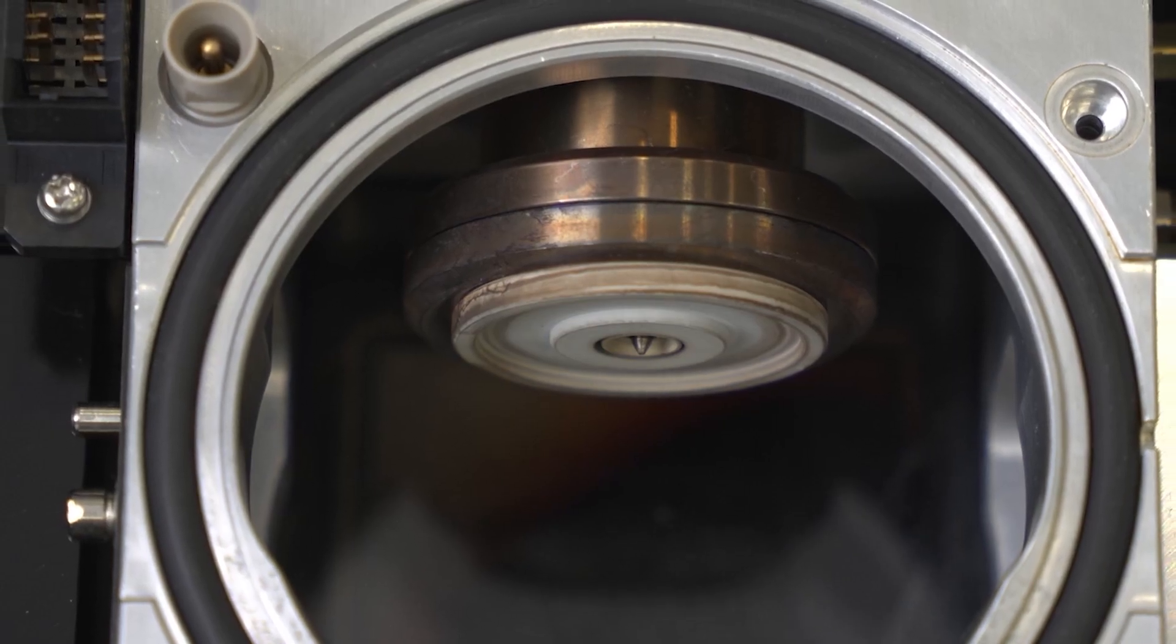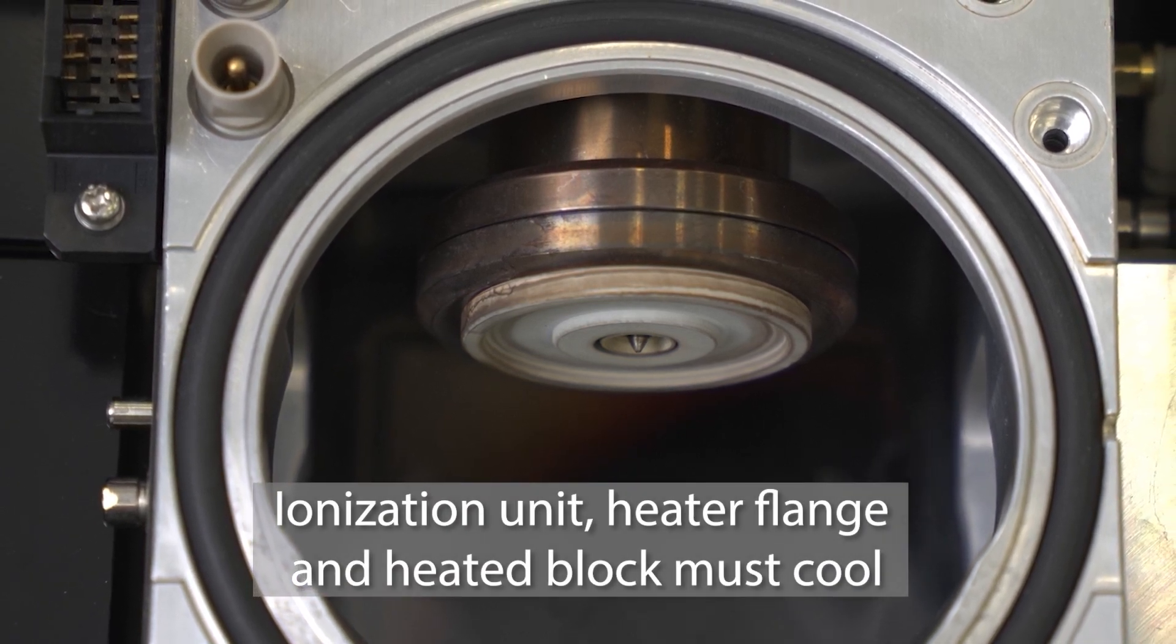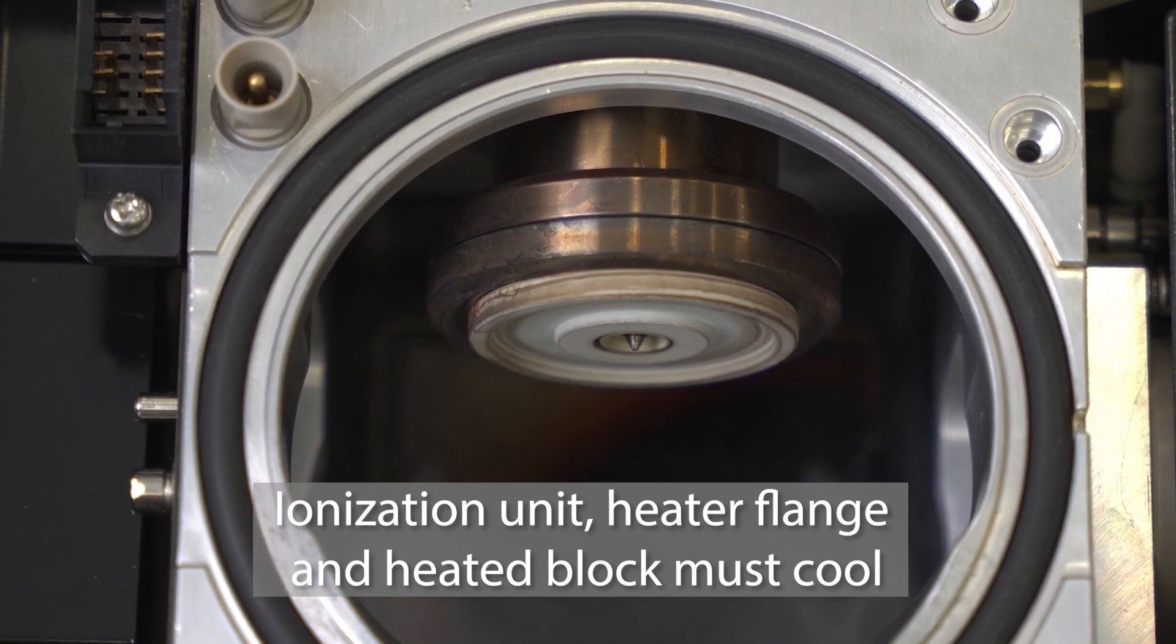After removal of the ionization unit, the source may be hot if recently in operation. Wait for the ionization unit, heater flange, and heated block to cool before performing any cleaning or maintenance.